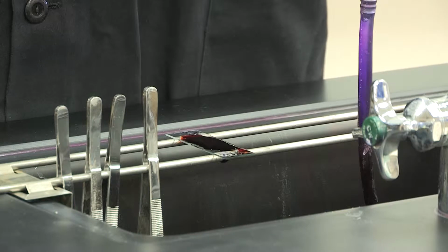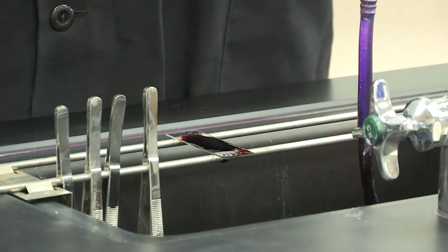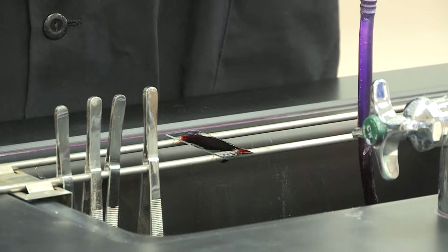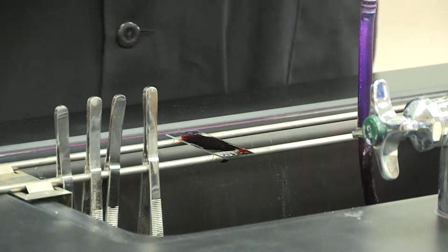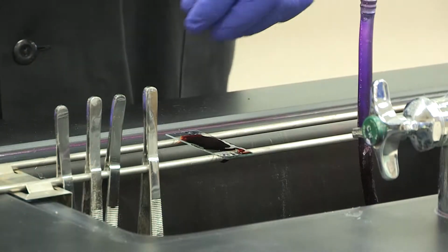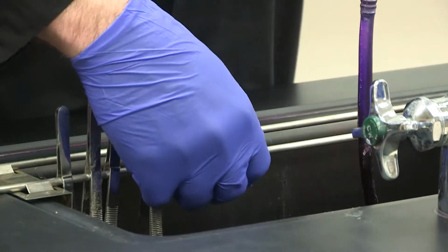Okay? Also note that some people in your class may be allergic to iodine, therefore you do not want to touch them with your gloved hands. So please keep your hands and feet to yourself. Now the next step, of course, is to rinse that off. Now after about a minute, you're going to let that cascade down again.